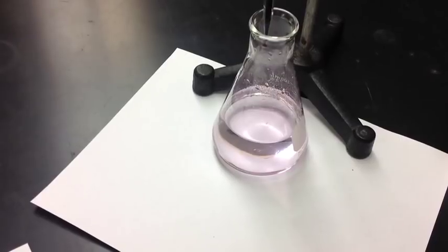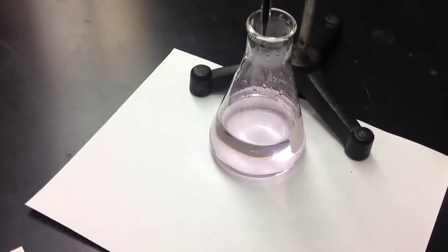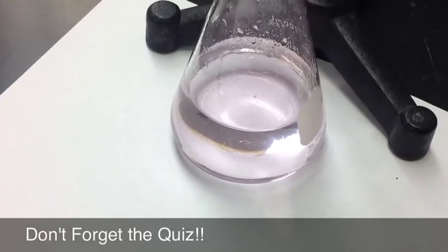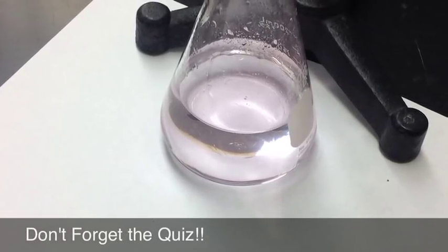But as soon as you get to the end you're going to notice that you've got this faint pink color and that's the perfect pink color. Hold on to that. Don't forget to put all of your waste into the beaker that's in the corner of the hood.